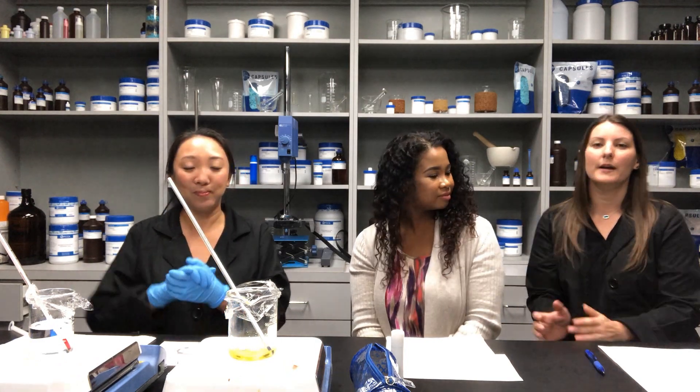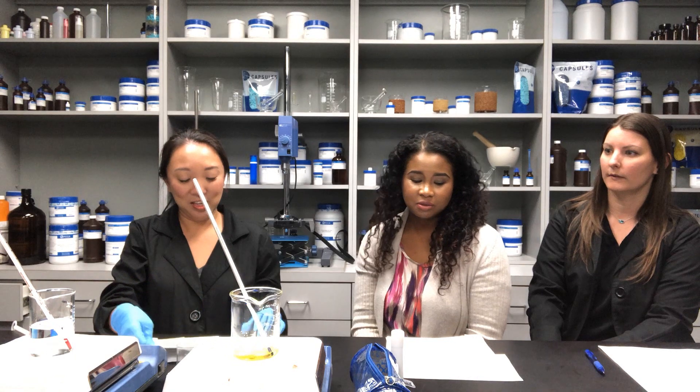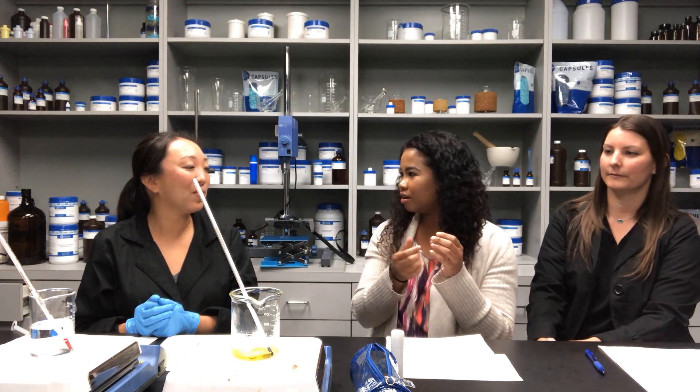I'm making two formulas today. Stacy, why don't you tell us about the formulas we're going to be working on? So Christine is going to make two things. One is formula number 8861, which is a clean lotion with jojoba oil — an oil and water emulsion and a really great moisturizer. For the longest time I mispronounced it as 'jojoba oil' until Christine educated me. The second is formula 10905, which is our lotion bar with coconut oil. I love the lotion bars — they're packaged so cool in tins or chapstick-style containers.